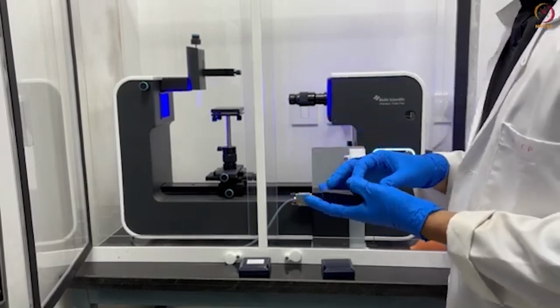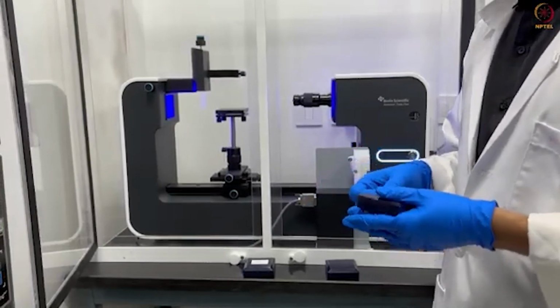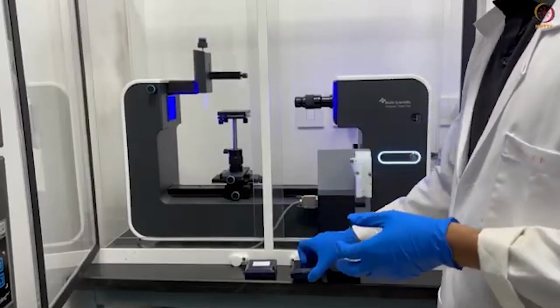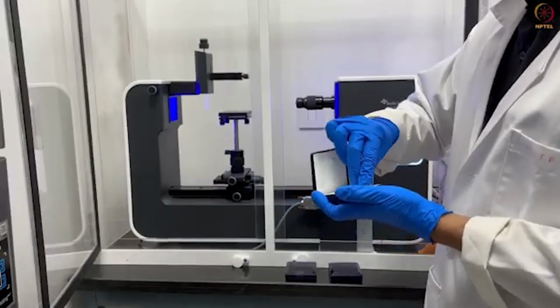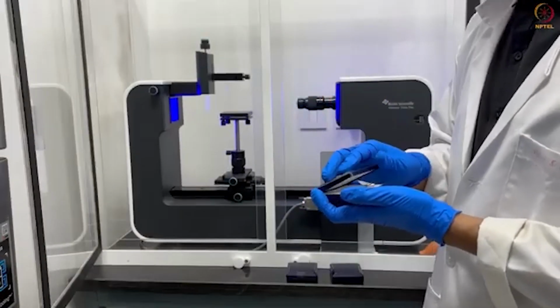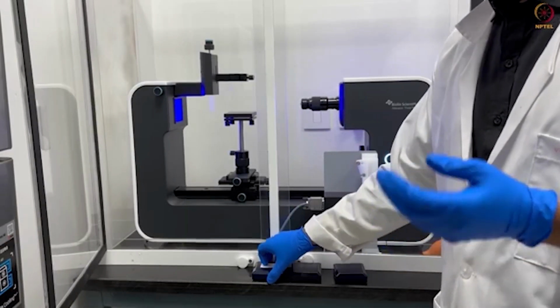Apart from this, if someone wants to measure the interfacial tension of an oil in water system, as you know, the density of oil is less than water. If you put the droplet inside water, it will float upward towards the interface. In this case, this J-type needle, or you can say U-hook shaped needle, will be used to measure the interfacial tension. All these needles can be set in different syringes available.